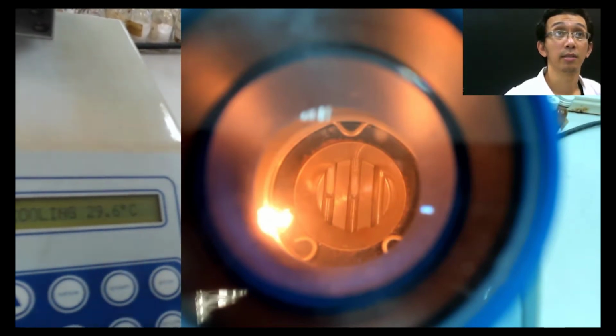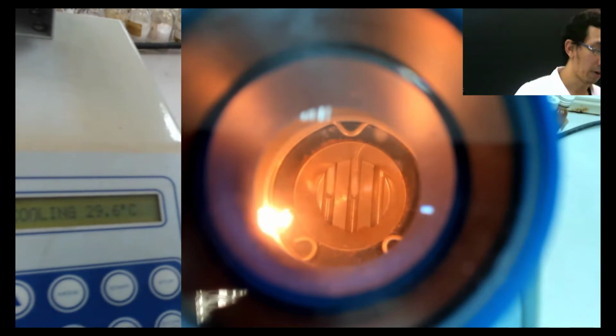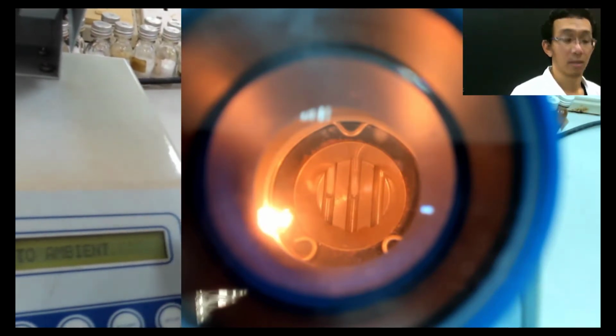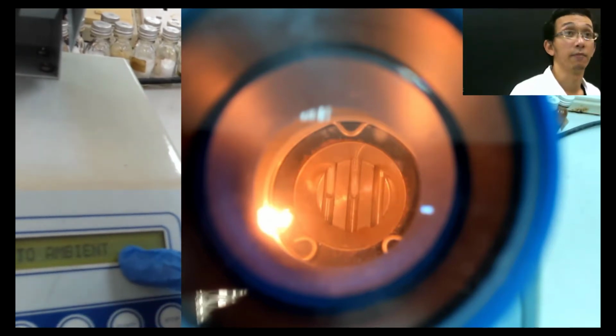What's important is just this. It's just what we call the number. Can you see now the number here? Is it clear, the number? Can you see or not clear? This number first.